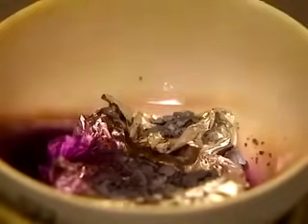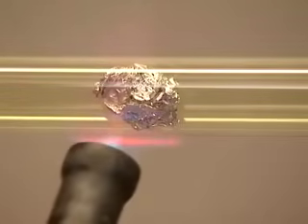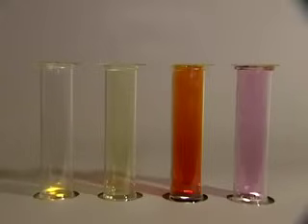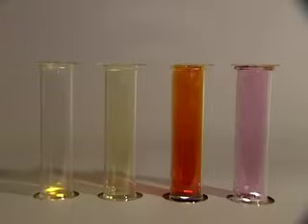The reaction with iodine is just as spectacular. A little warming helps to get things moving, but once the reaction is off it needs no further assistance. The products of all four of these reactions are white solids, and they're all trihalides: AlF3, AlCl3, AlBr3, and AlI3. Now aluminium is a trivalent element, so in these compounds the halogens are all showing a valency of one. That valency of one is also satisfied when the halogen atoms bind to one another in the diatomic molecules with which I started this sequence.